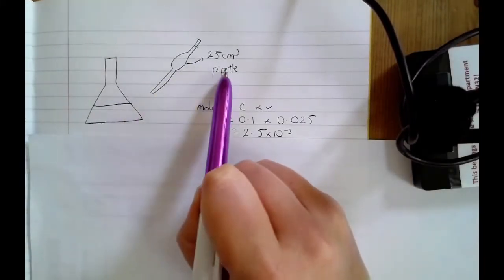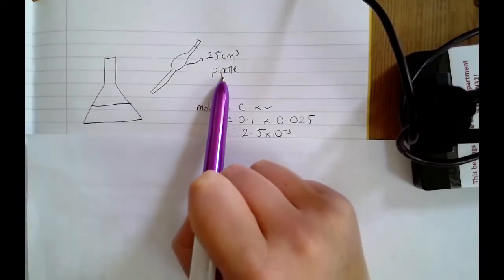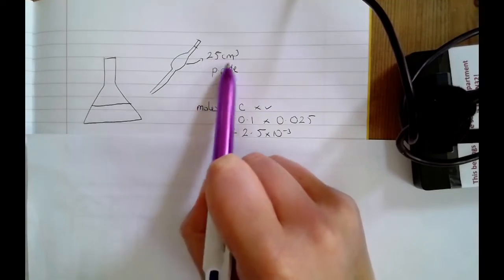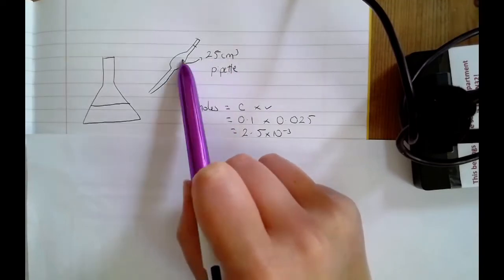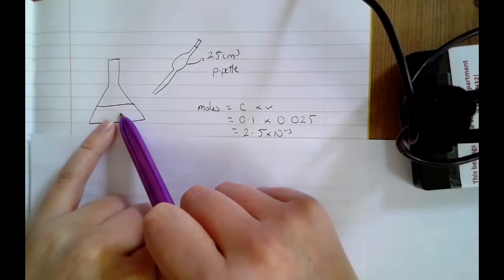And to do this, I'm going to need to use a pipette. And pipettes are pieces of glassware that will accurately measure out 1 volume, in this case 25 centimeters cubed. So I use my pipette and I add my sodium hydroxide to my conical flask.